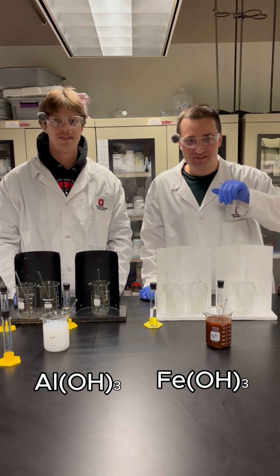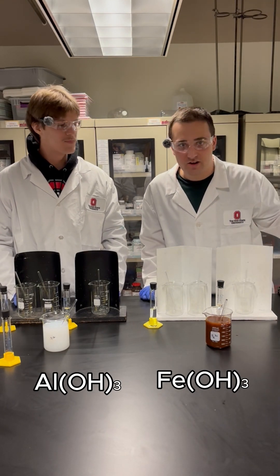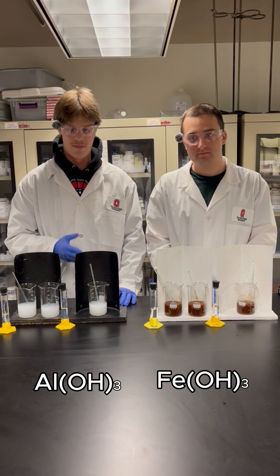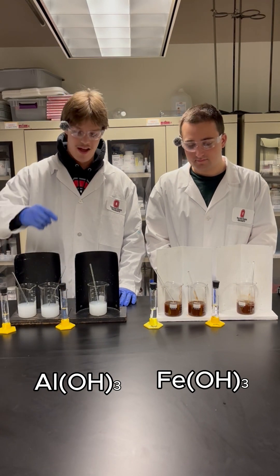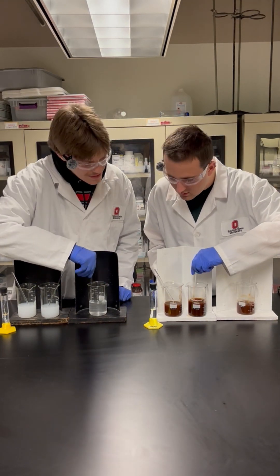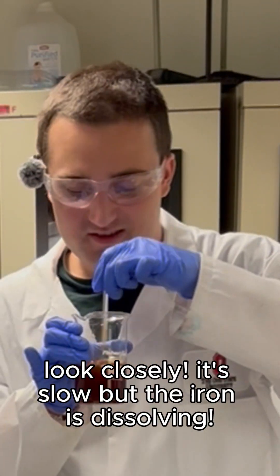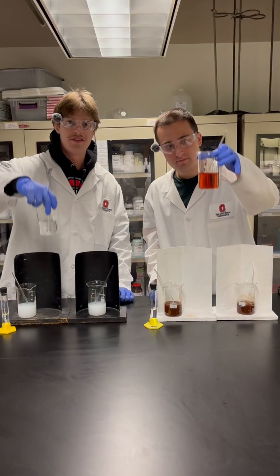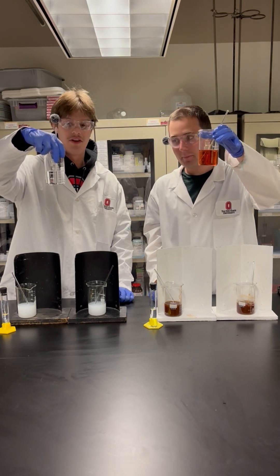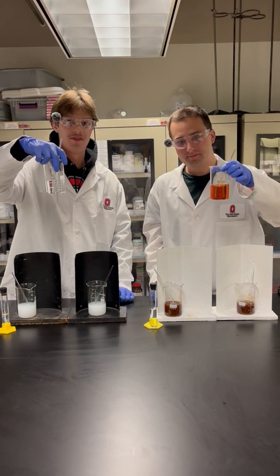Now that we have our solutions here, we're going to split them evenly among the three beakers. Now we will add nitric acid to our beaker, which is a strong acid. As you can see, the acid reacted with both hydroxides and dissolved the precipitates, which shows that both solutions can act as bases.